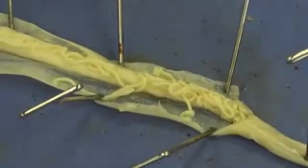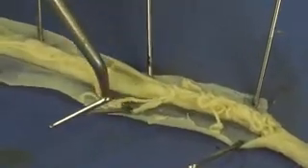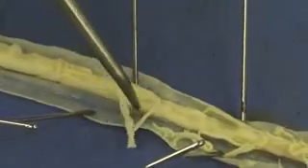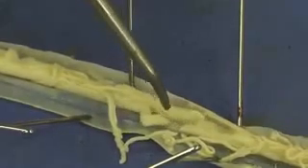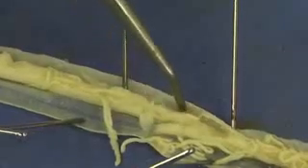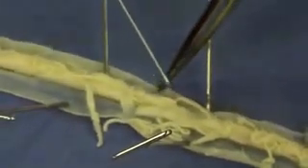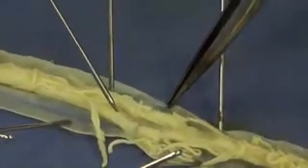Eventually the egg is going to reach a uterus — two uteruses. They're going to be larger round structures in here. I'm peeling away some of the oviducts to see the uterus, and there you can see one. They're very easy to damage, but this is going to be one uterus right here. And you can see the other uterus, which I've actually damaged a little bit, right there.